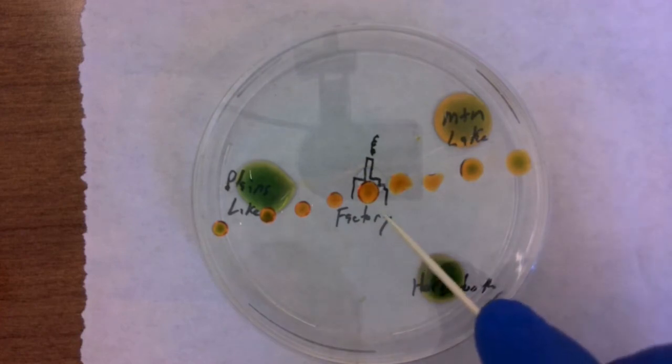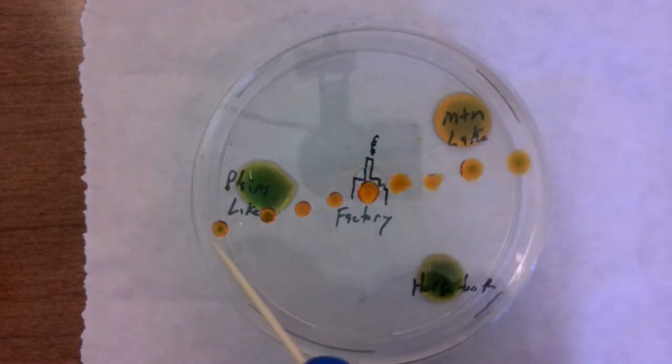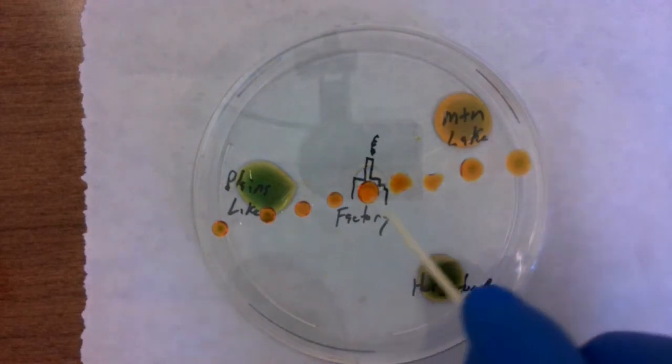So as that factory is giving off more and more of those chemicals, those chemical compounds that are getting into the water and creating an acidic solution, we're seeing these changes take place. All right, this is about as acidic as our clouds are going to get. So remember that orangish color is indicating probably a 3 to 4 on the pH scale. So it's not the most acidic like red, but it's pretty acidic.